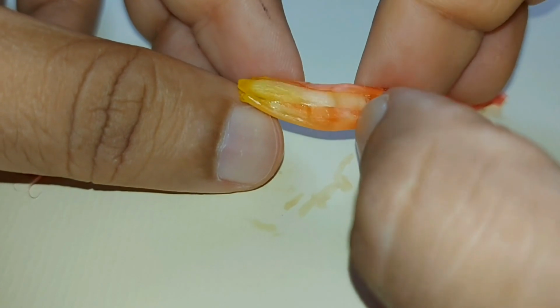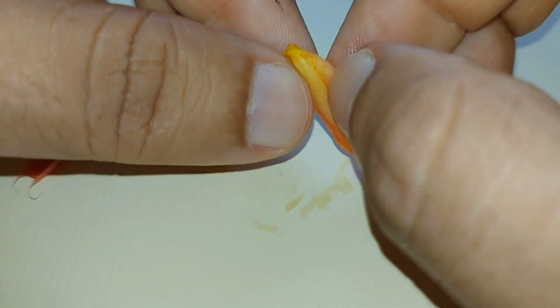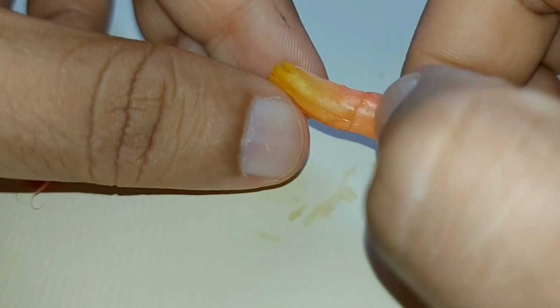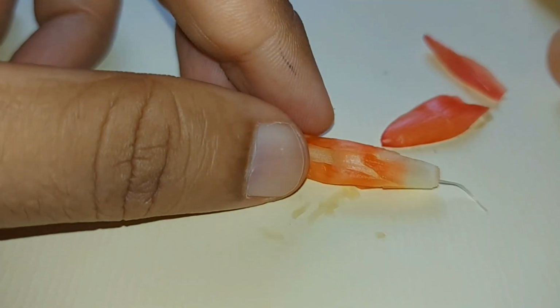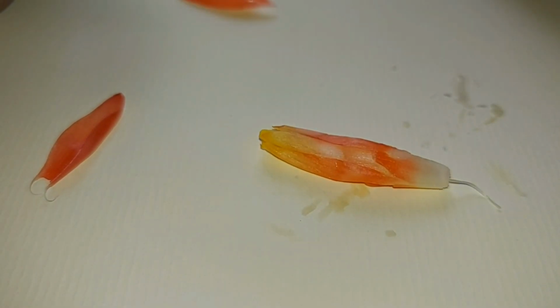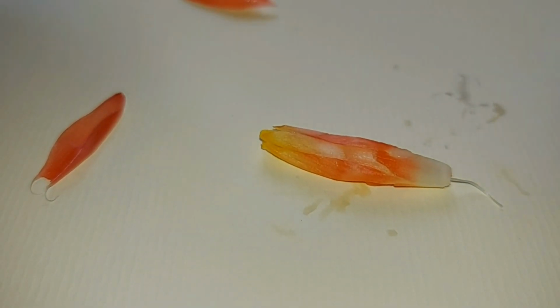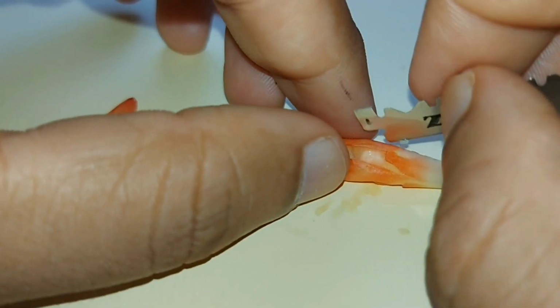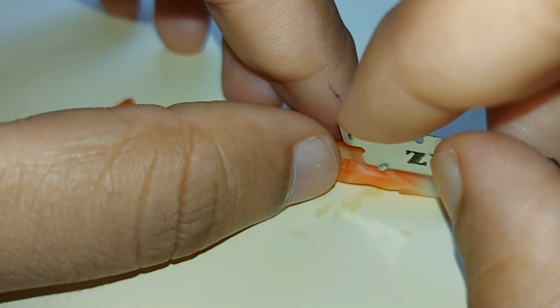Okay, once the petals are peeled back, you can almost immediately see the underdeveloped anther, which is a part of this flower. Now what I will do even further is I will dissect the flower itself.